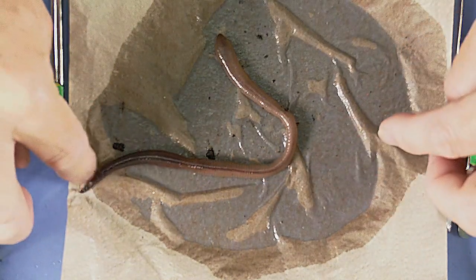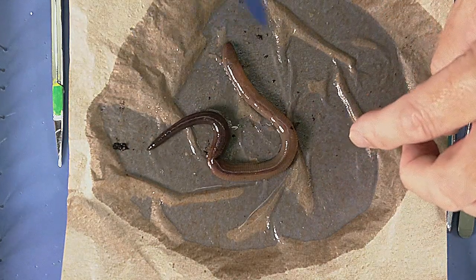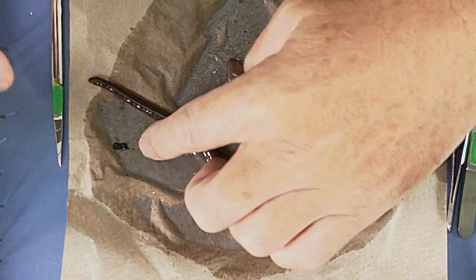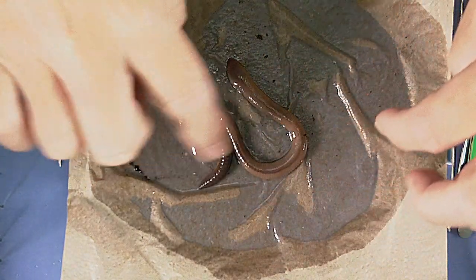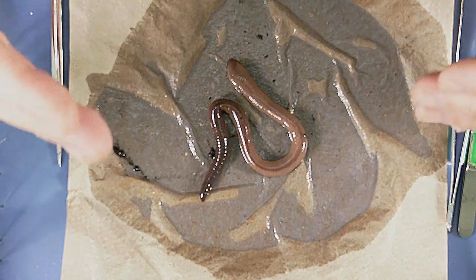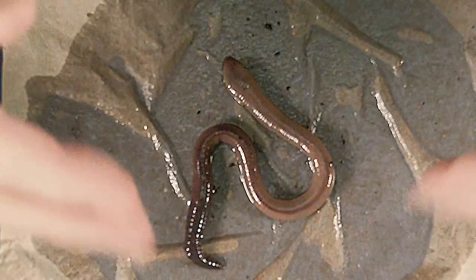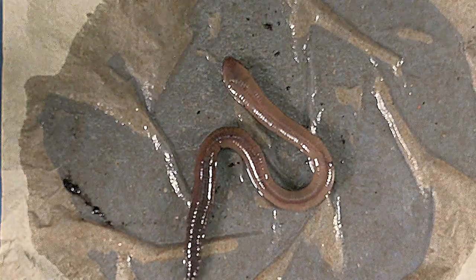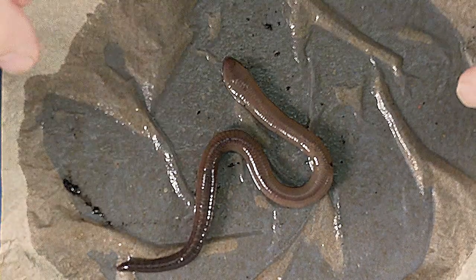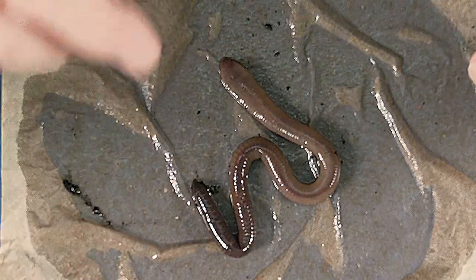Let's look at some of the external characteristics of the earthworm. I have to keep this animal moist — that's why I'm continually dousing it with water — because they breathe through their skin. That's where they undergo gas exchange. The skin needs to be kept moist because gases diffuse from the atmosphere into the moisture covering their skin, then move into the blood and the capillaries in the epidermal layer. Otherwise the animal can suffocate.